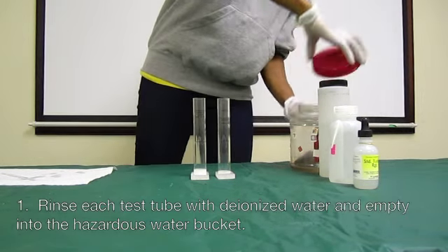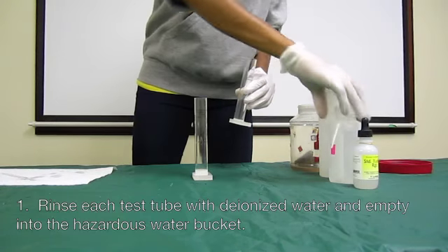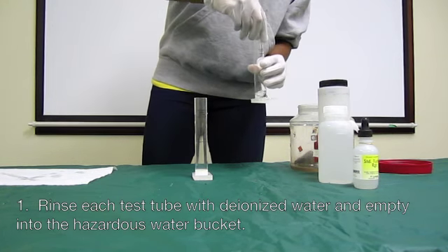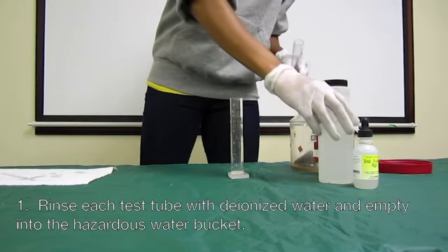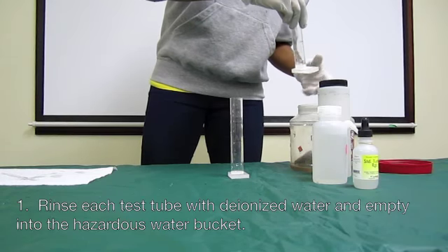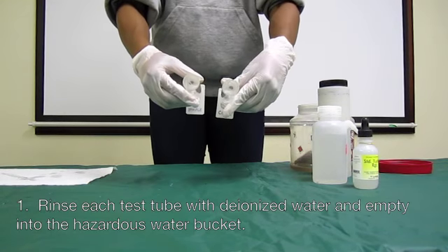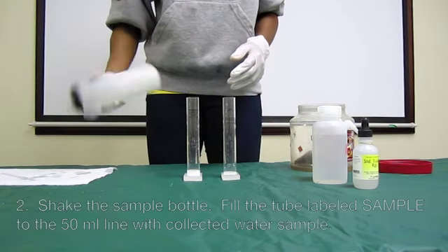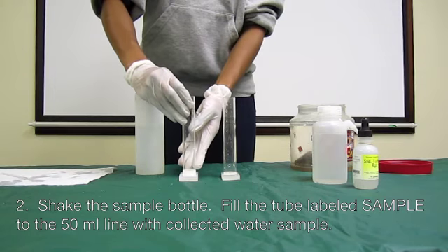Rinse each test tube of deionized water and empty into the hazardous water container. Shake the sample bottle. Fill the tube labeled sample to the 50 milliliter line with your collected water sample.